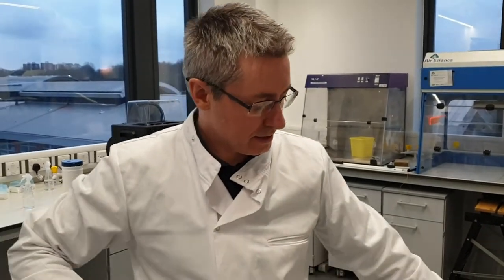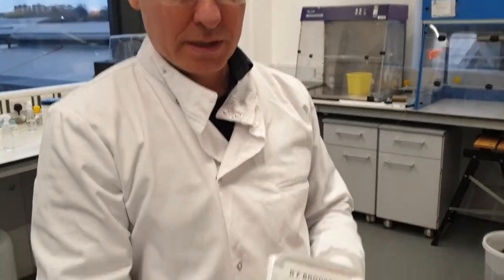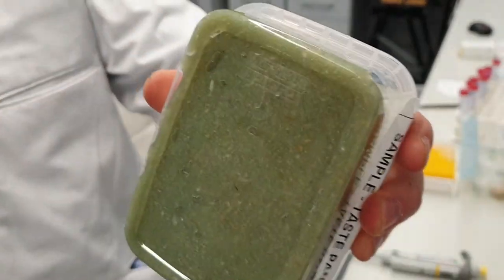Okay, so this afternoon we're going to be testing some puree. This is garlic puree. I'm going to bring it up to the camera so you can see it.